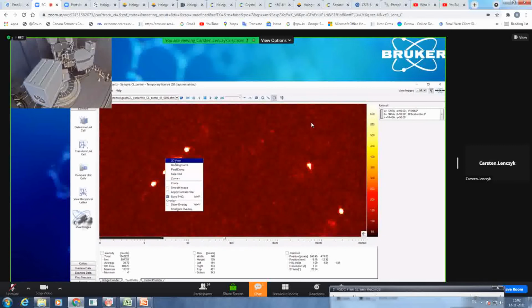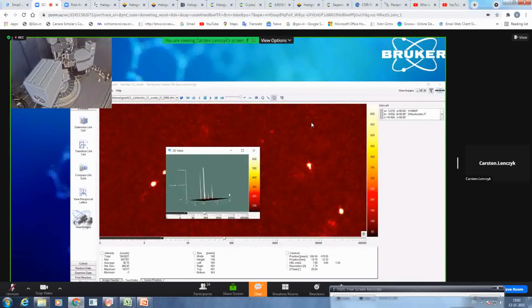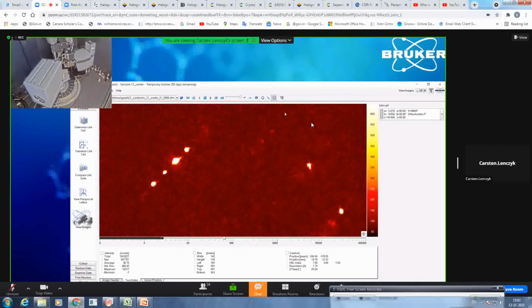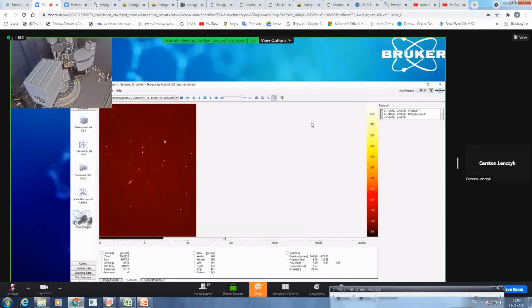You can also go to this 3D view, and there you also see information how intense your signals are. So here you see 3 normal signals and 1 which is cut off. So this is a very, very intense signal and will most likely lead to the information that this is topped. And I will get back to this anyway when I am telling you more about the fast scans. So overall, I would say this is a pretty good crystal.